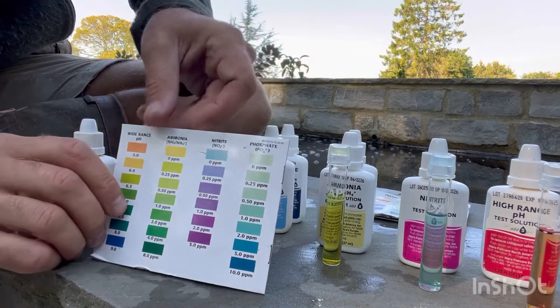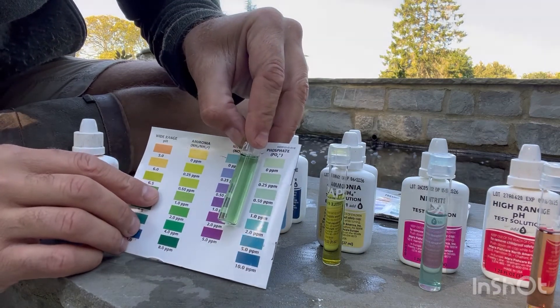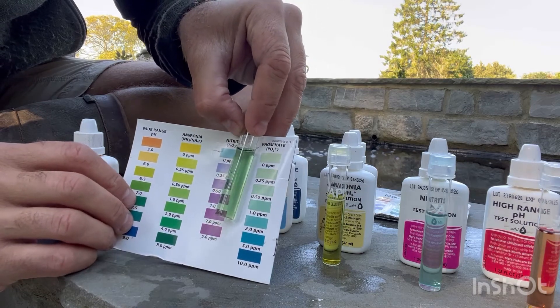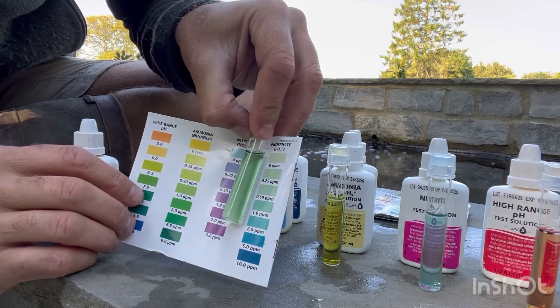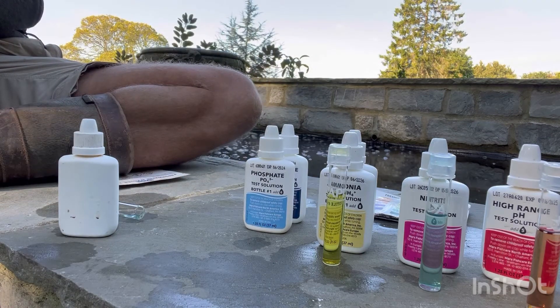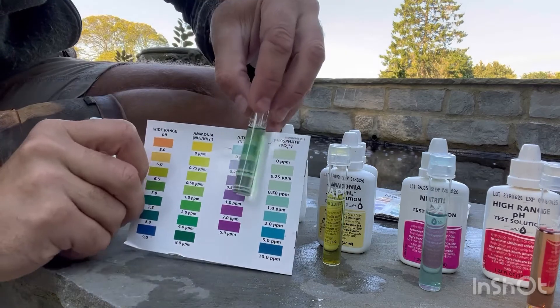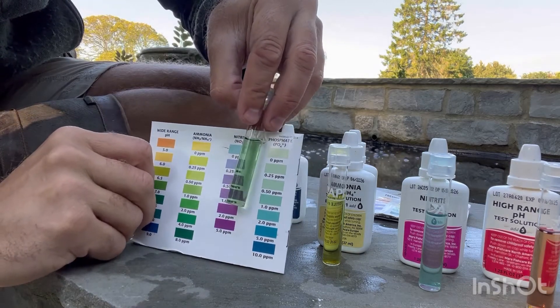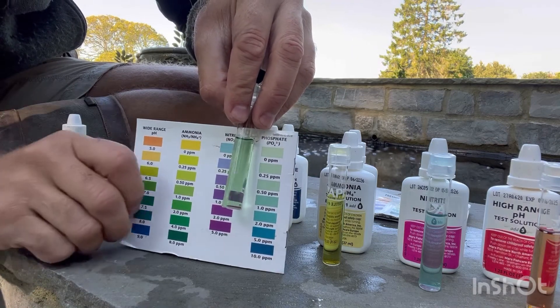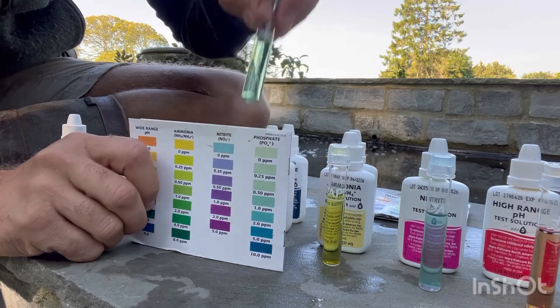And then phosphate. If you've got a nice light green color, you've got no or very low phosphate in your water. I'm just going to check this up close. For me that's somewhere between zero and 0.25 parts per million. That's where you've got to be careful of your surroundings when you're working next to the pond. Well happy with that as well.